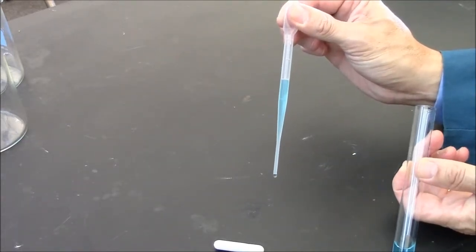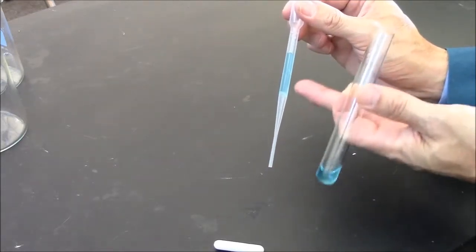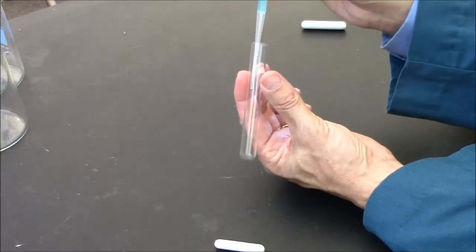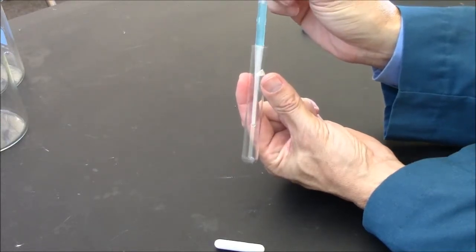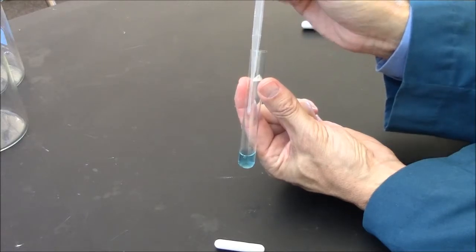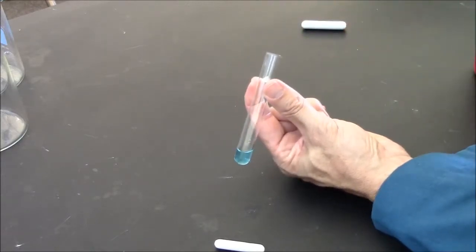If I let go now, this is still one milliliter of liquid. I also have some air in here. When I deliver to the small test tube, the air doesn't count. If I squeeze out everything, that's one milliliter in my test tube.